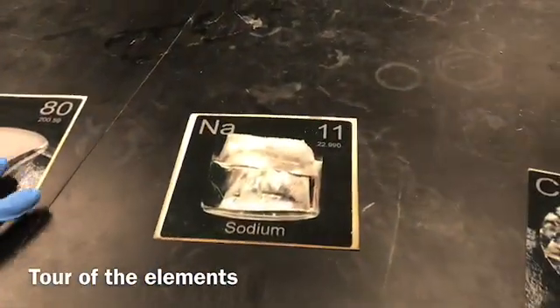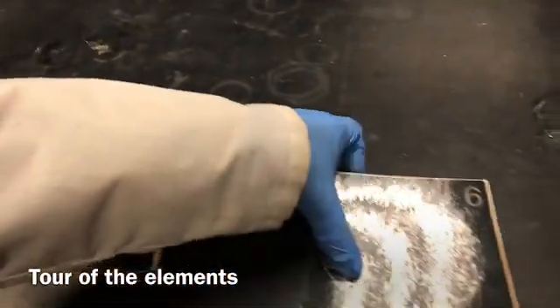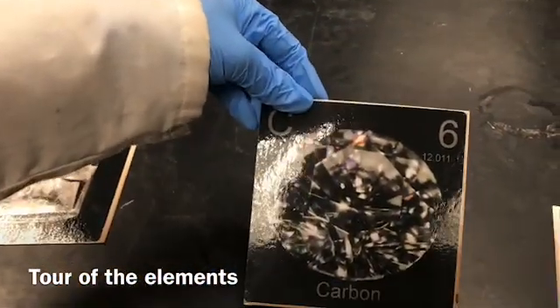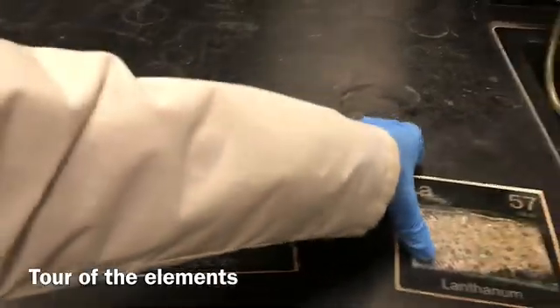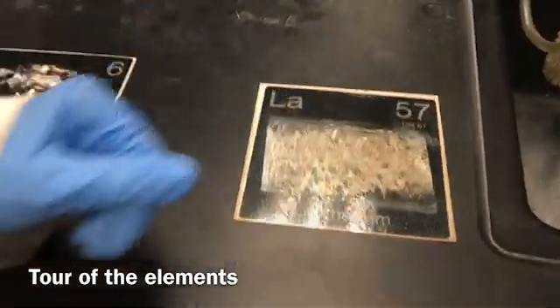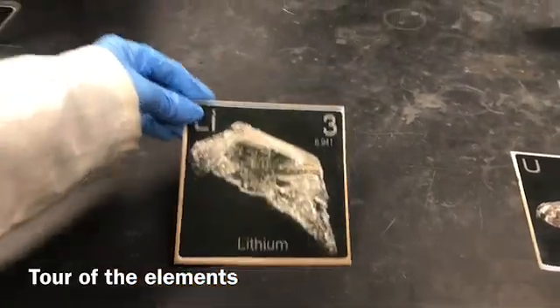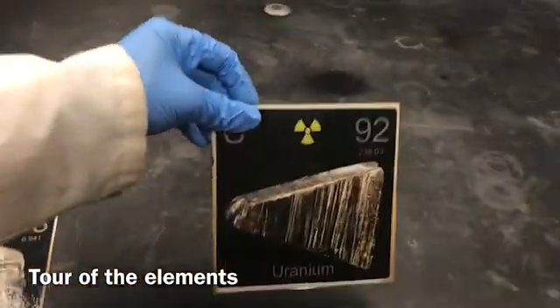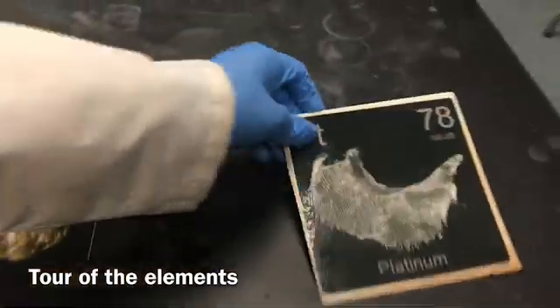Some of these are dangerous elements — mercury and sodium. Carbon in the form of diamond is also shown here, which is very expensive. Also on display: lanthanum, lithium, uranium, gold, and platinum. That covers all the elements in experiment number three, density and tour of elements.